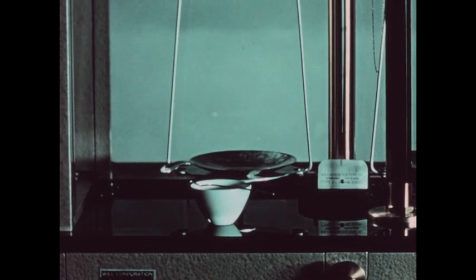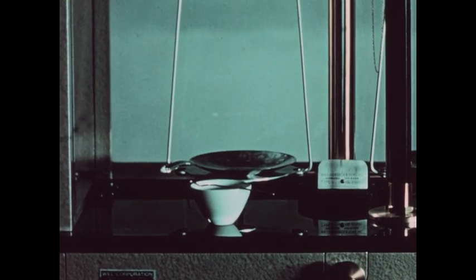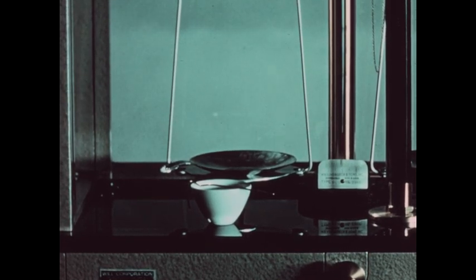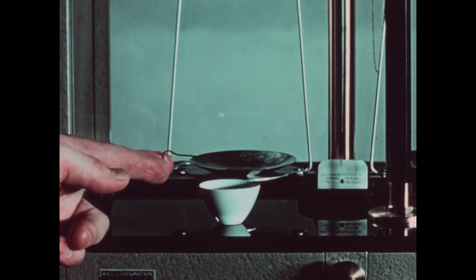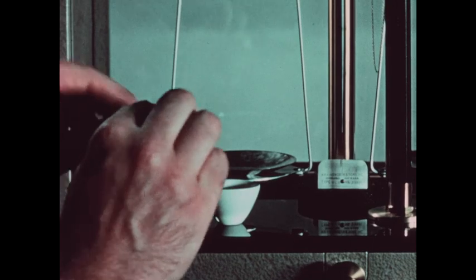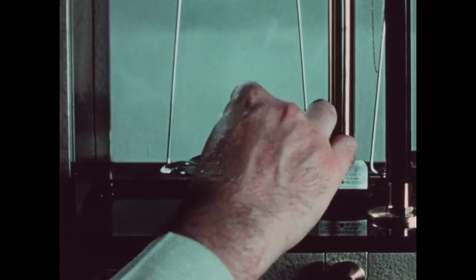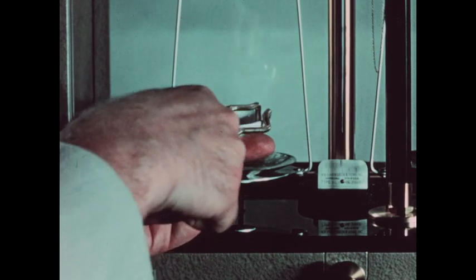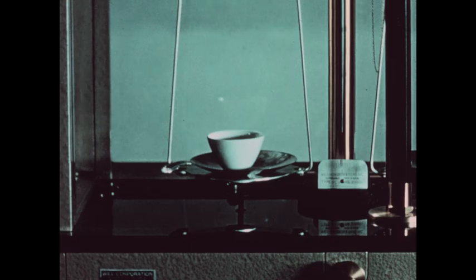After determining the weight of the crucible, we will now add a small piece of copper to the crucible, then weigh both together accurately. By subtracting the weight of the crucible from the combined weight, we may obtain the weight of our sample of copper. A small piece of copper wire weighing approximately one gram has been folded up into a convenient size and placed in the crucible, which is then replaced on the pan of the balance.